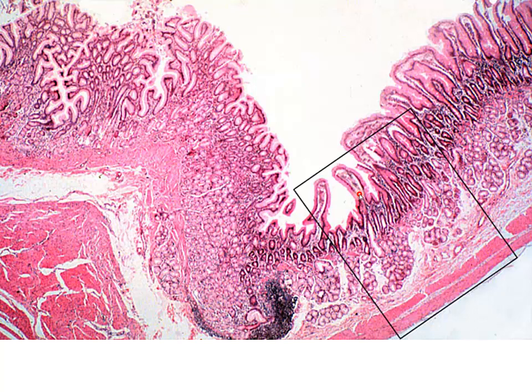Here we can see these large central lacteals in the middle of these intestinal villi. There's a good one there. There you can see a good villi with the central lacteal material in the middle. And then these are going to be our crypts of Lieberkühn extending down, discontinuous muscularis mucosa through here, and our Brunner's glands down in the submucosa.